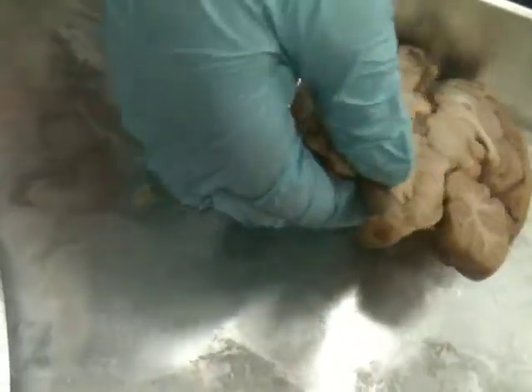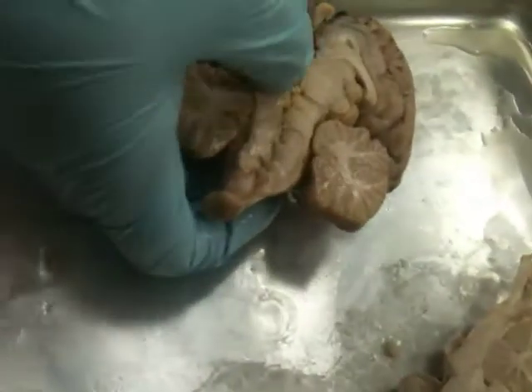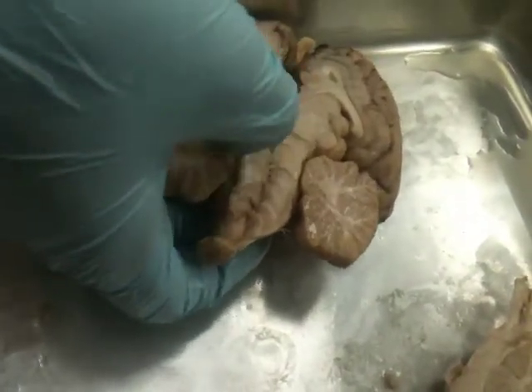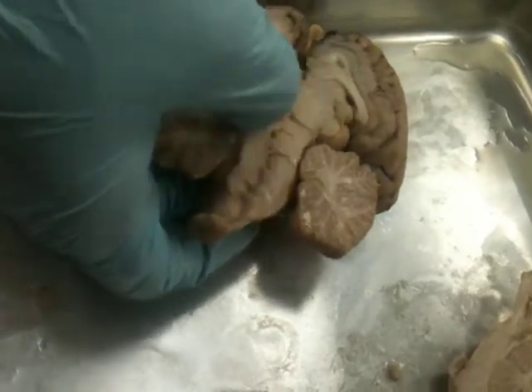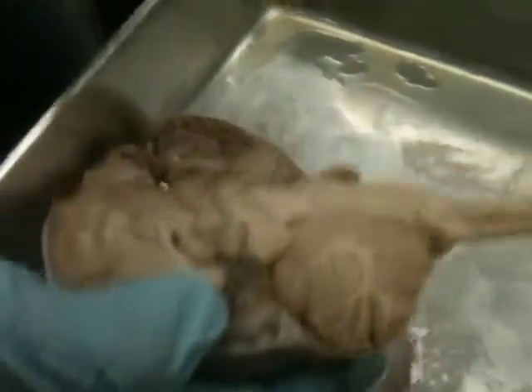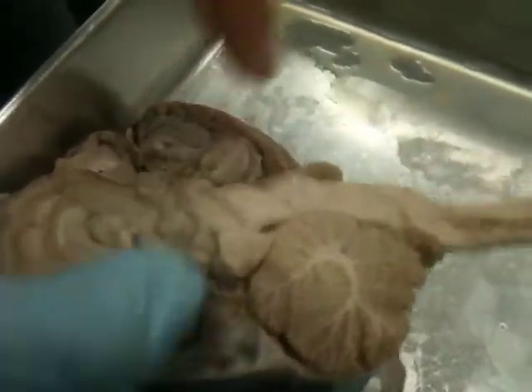Below the cerebellum is the brainstem, okay? And when you look at the brainstem, you can see when it starts, it's a little bit wider, where it's first connecting to the cerebrum, and that first wider part is the pons. So you can see it clearly on this one. You can see it's like a little pucker coming off right there.